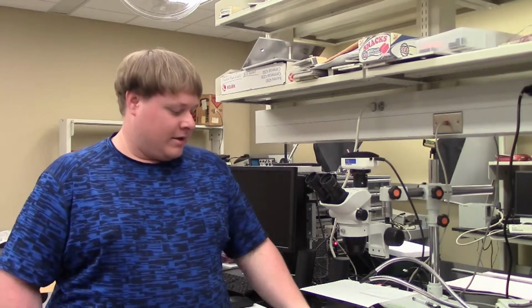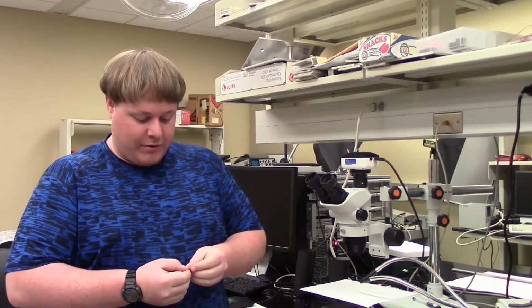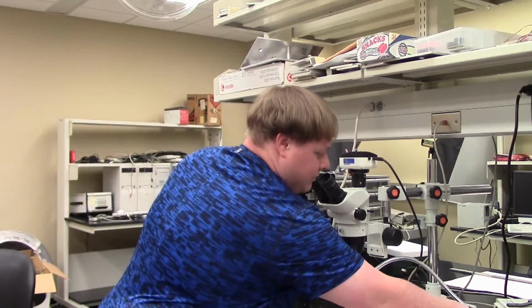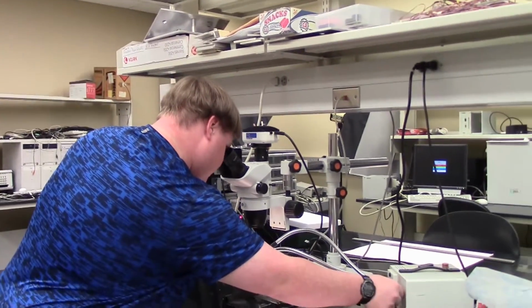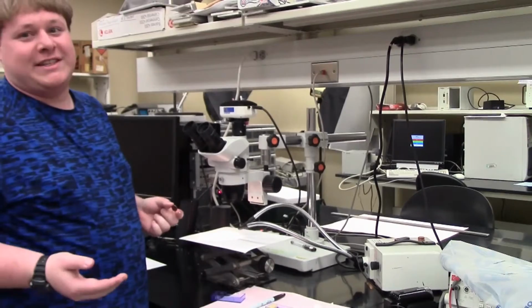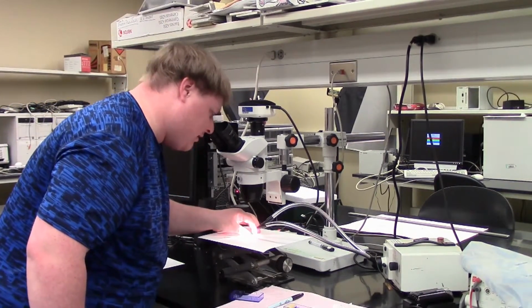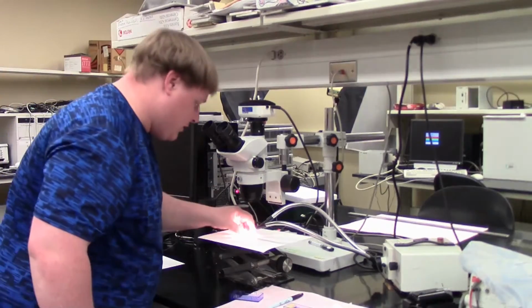Okay, now that we've used the calibration slide and checked the measurements, they look good. Now it's time to get to our penny. And so again, we're going to look at the T in cent. Now, first things first, turn on the light. It's really the same process as before, except with the penny. And you start at the lowest setting.